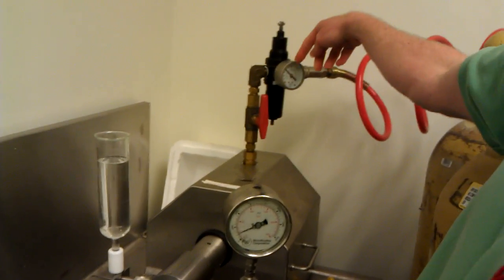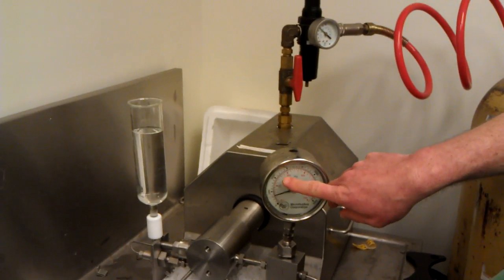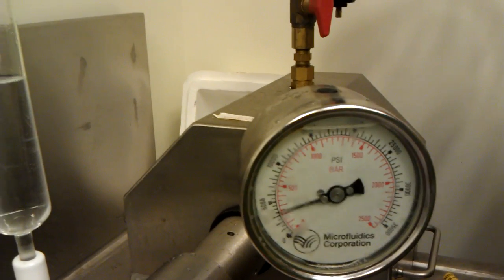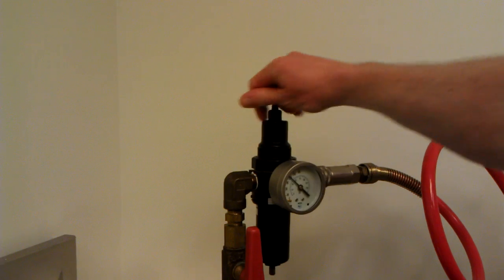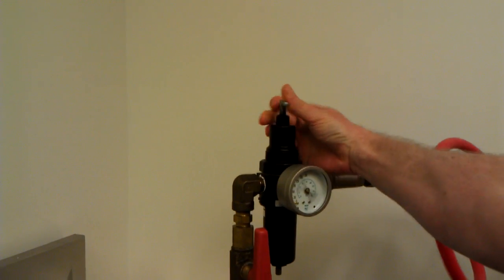Here you can adjust the pressure. As you can see here it's about 12 to 13,000 PSI. As it is up here on the gauge, it's also about 12,000 PSI. So these correspond to approximately the same units.